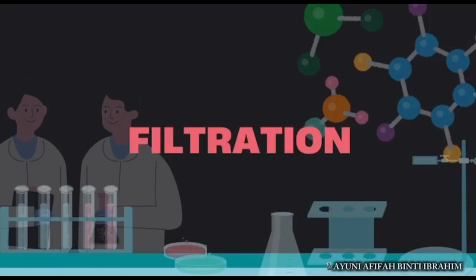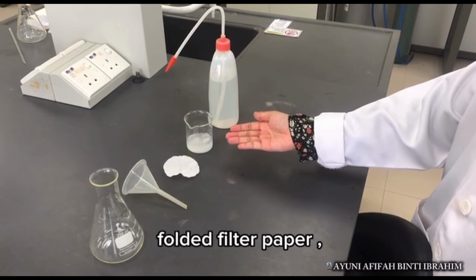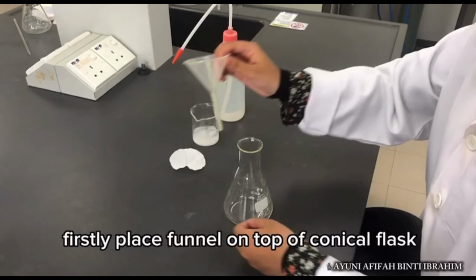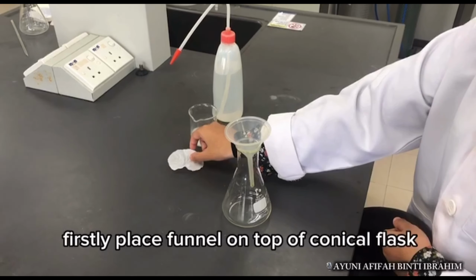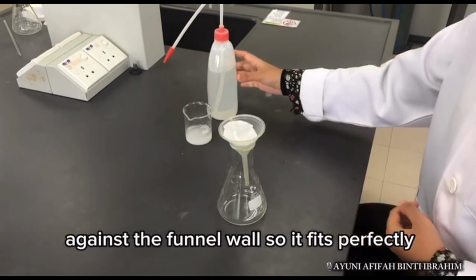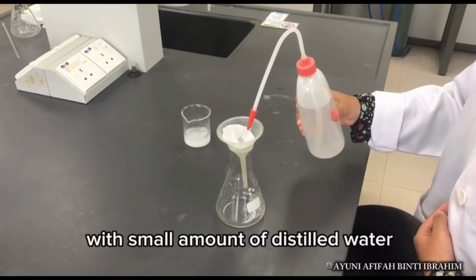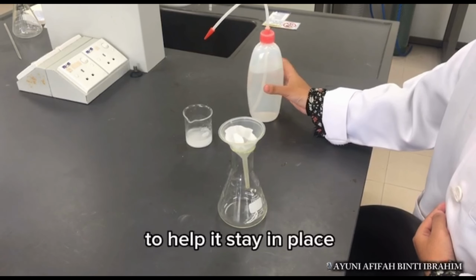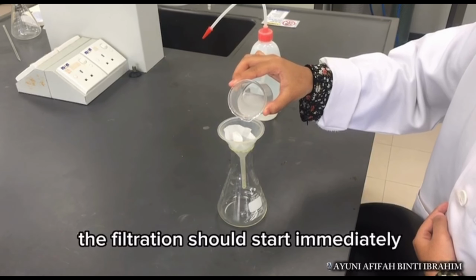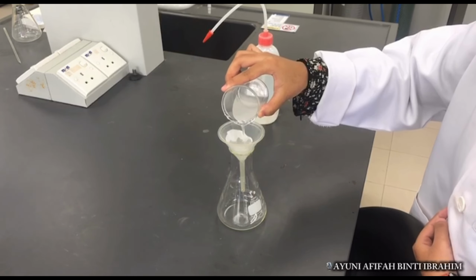Step number 4, filtration. We need to prepare distilled water, the mixed solution, folded filter paper, funnel and conical flask. Firstly, place funnel on top of conical flask. Gently press the filter paper against the funnel wall so it fits perfectly. Wet the filter paper with small amount of distilled water to help it stay in place. The filtration should start immediately. Slowly pour the mixture into the funnel.